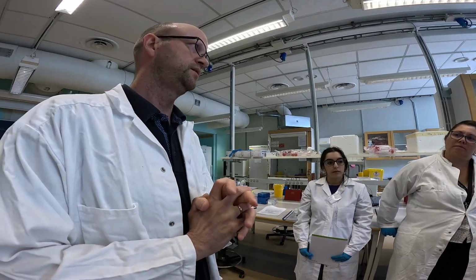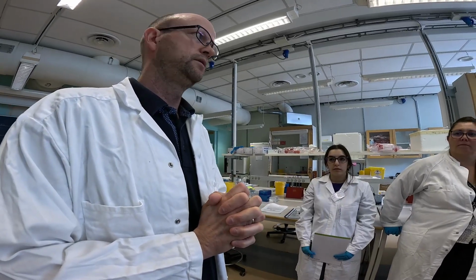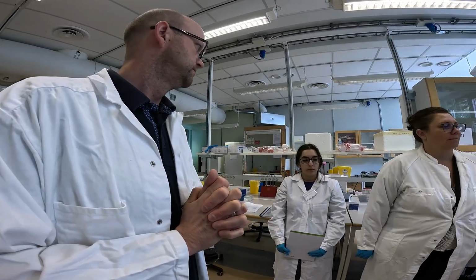to continue because we have up to 20 microliters of cell suspension. Okay, let's continue with the lysis.